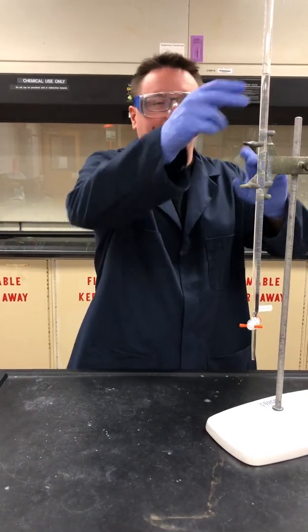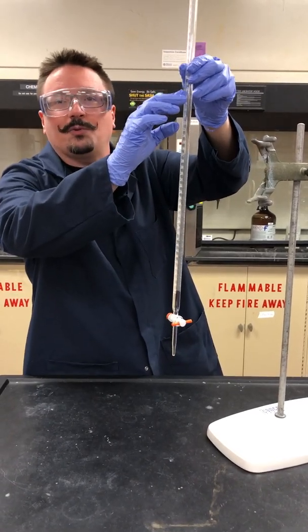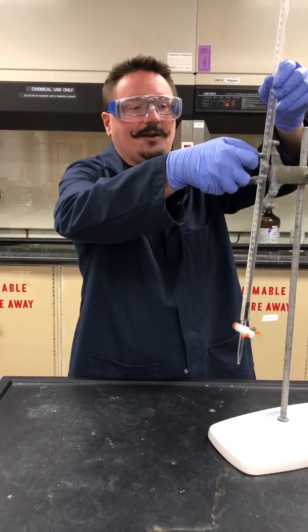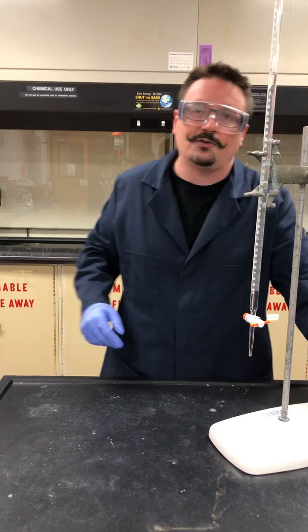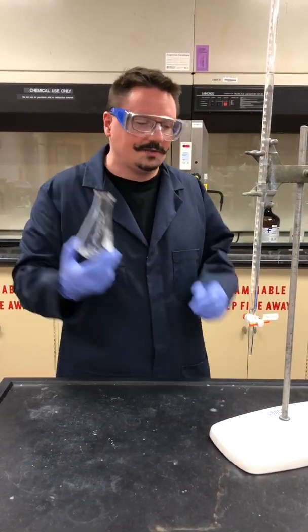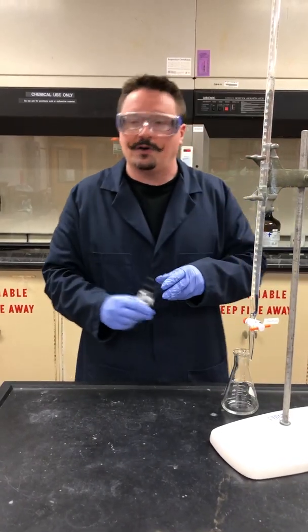So I have my burette here. You'll notice the burette is a very specific piece of glassware. It has a lot of very precise gradations on it, so this allows us to be very precise and exact in the amount of liquid that we measure out. This is full of sodium hydroxide, and here I have some hydrochloric acid. I don't know the concentration of the hydrochloric acid, but I do know the concentration of sodium hydroxide in the burette.